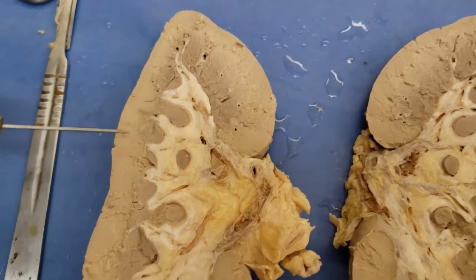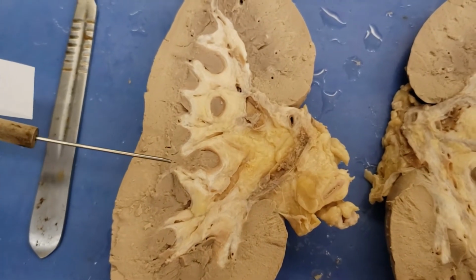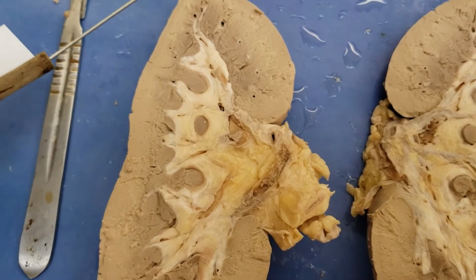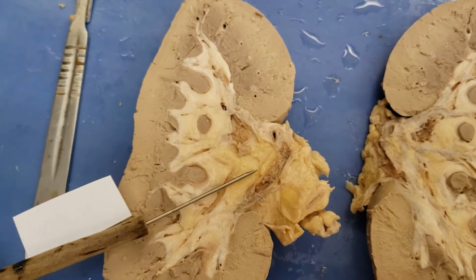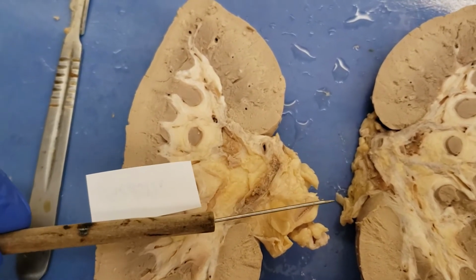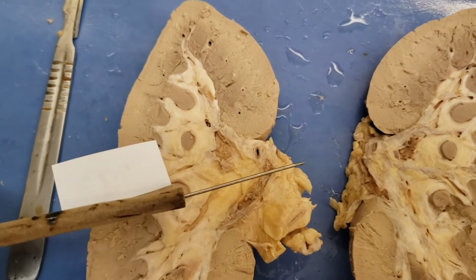But that's part of the main drainage process. So nephrons, most of them are found only in the cortex, and we have a few that will dip down into the medulla. But the point is, urine formation occurs from the outside all the way in, dumped into this region where this essentially would just be a pool of pee, and then it leaves the kidney via the ureter down to the bladder, where it'll leave the body via the urethra.